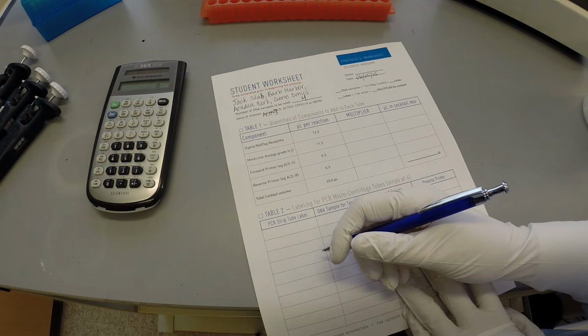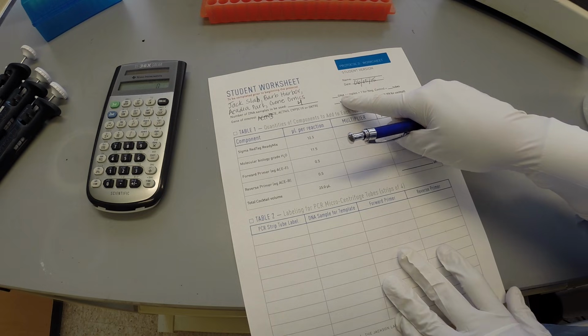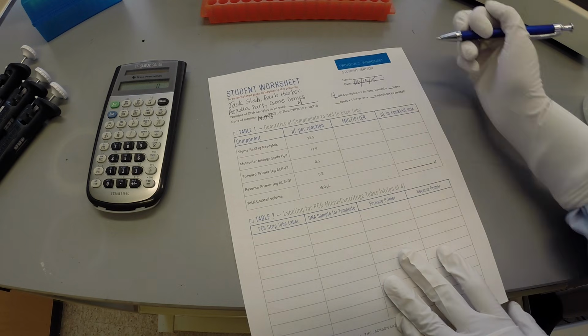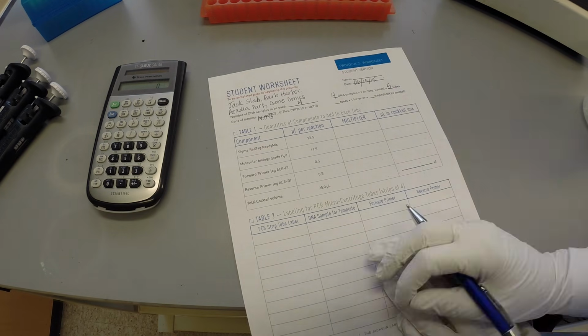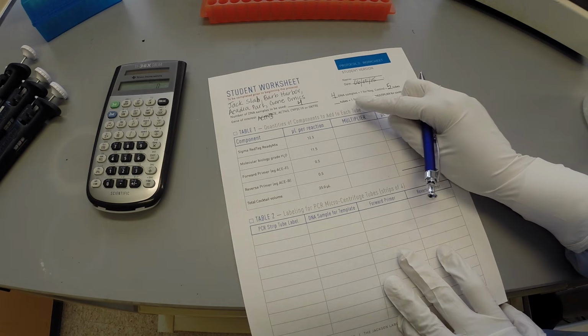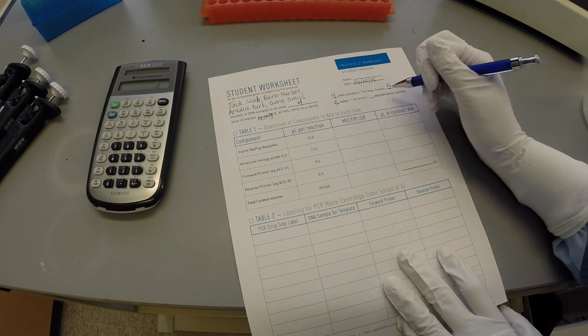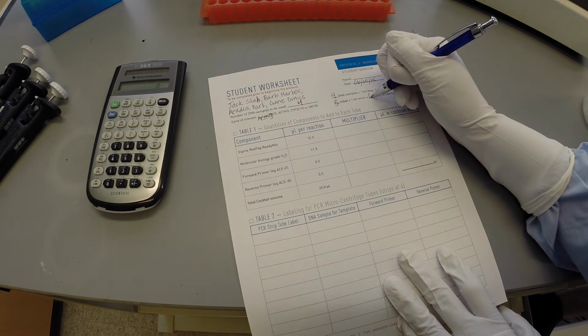On the right-hand side, students use the equations to determine the number of tubes needed and the multiplier for reagent volumes. In addition to the 4 DNA samples, a negative control sample is always included. Therefore, 5 tubes are needed for the PCR reaction. In the creation of the cocktail, pipetting error is accounted for by adding another sample. Therefore, the multiplier for this group is 6.